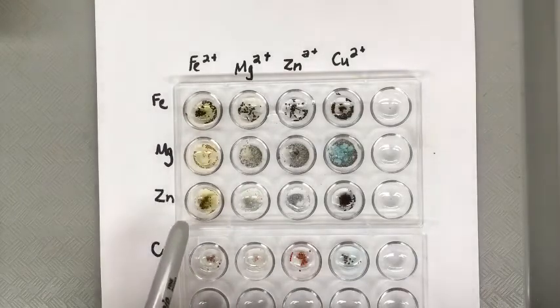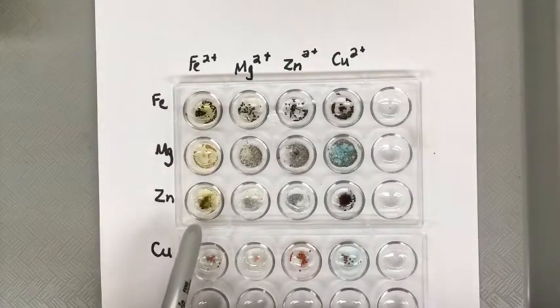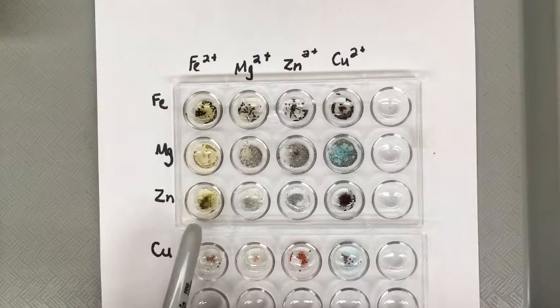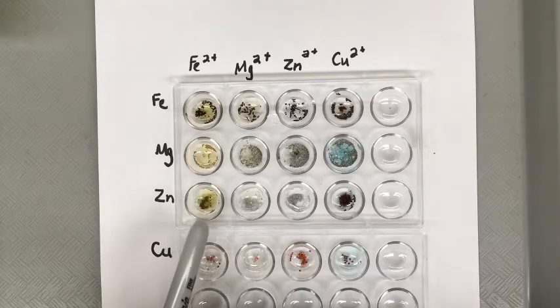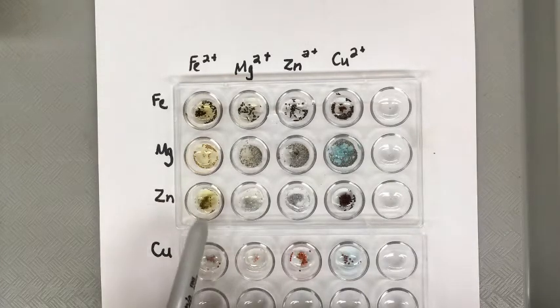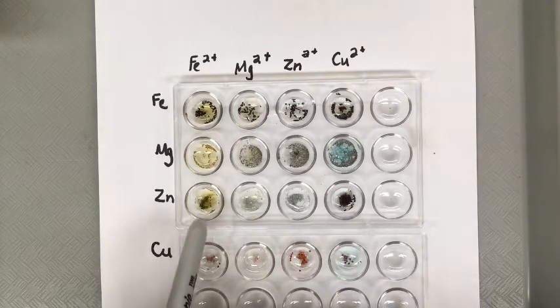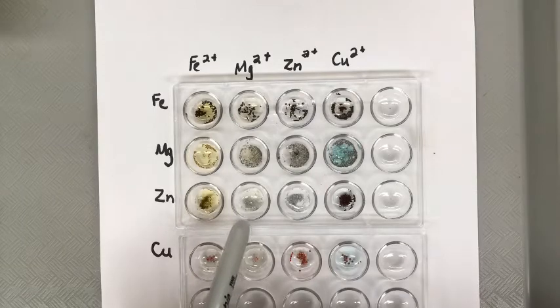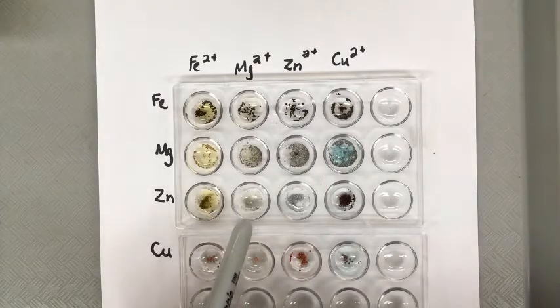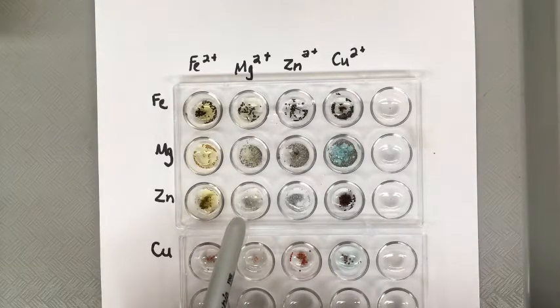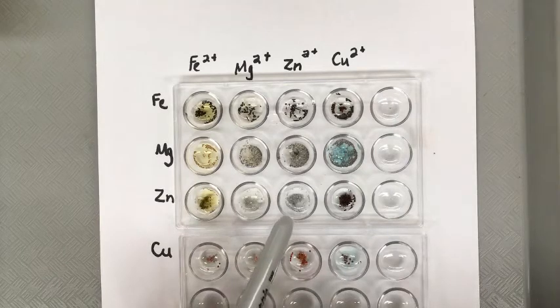When we drop down to zinc, zinc reacting with the iron solution, there was a reaction. So zinc was more reactive than the iron. There's a color change, they've kind of turned orange and the iron solution actually is changing color too. When we move over to magnesium, there's no change. So the particles just seem inert. Go over to zinc, same thing, not much change.